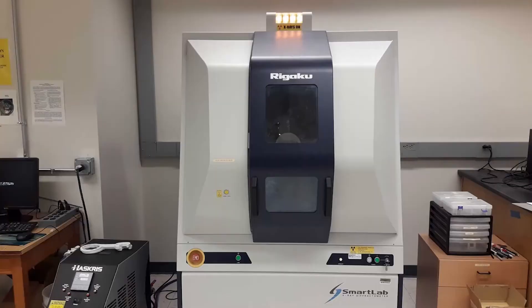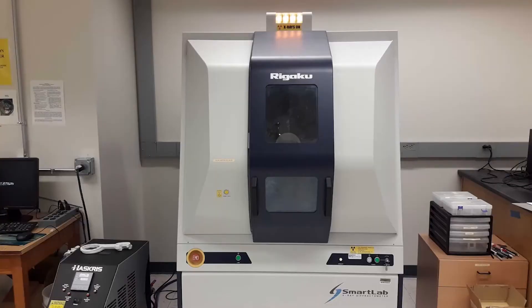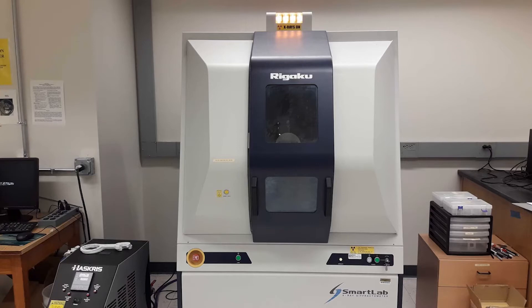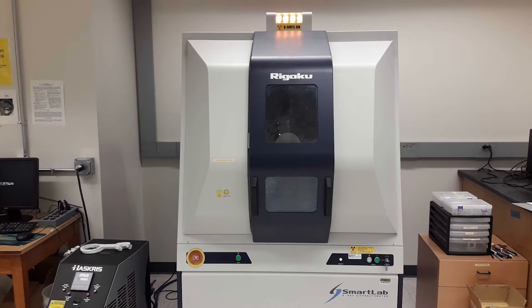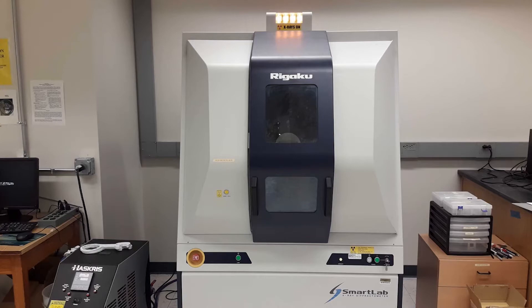X-ray diffraction allows us to identify the crystalline phase of a material. We use this XRD to determine if crystalline material is present in a sample and to confirm the type of zeolite framework we have synthesized.